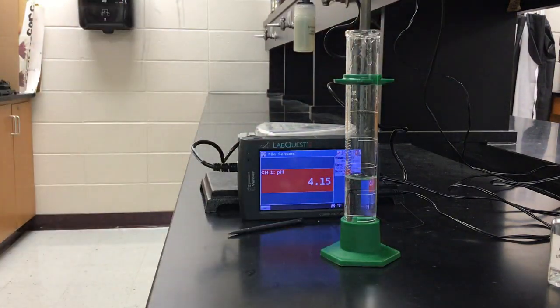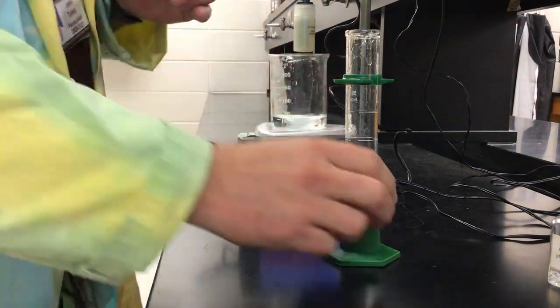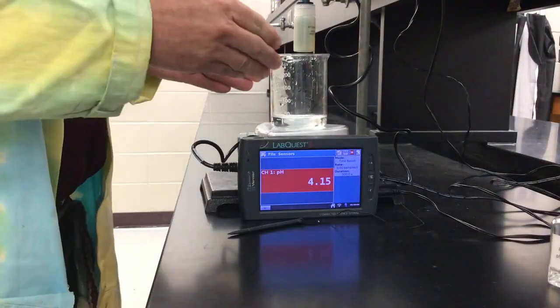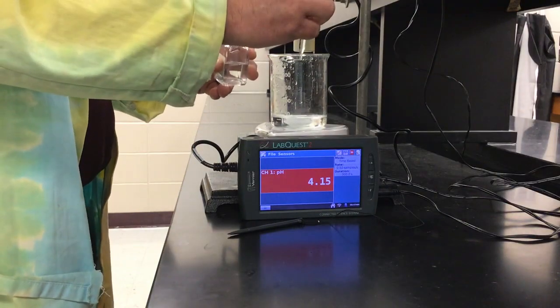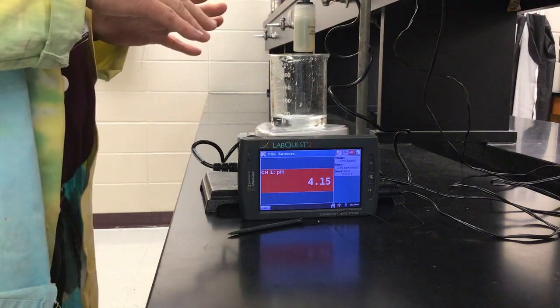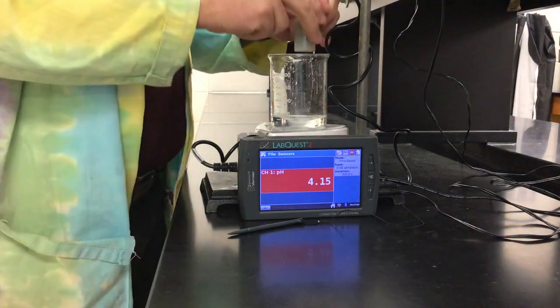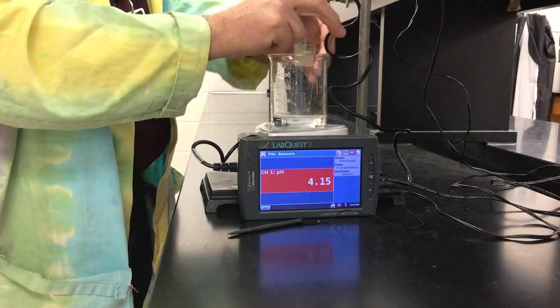So that's 25 milliliters exactly. That was good. So I've got my 25 milliliters here. I'm going to set that off to the side. And I've got my 25 milliliters of my acid solution here, and I'm going to add just a little bit of phenolphthalein, 3-4 drops, in there so that I can see where that equivalence point is going to be. And I'm going to lower my pH probe into the solution so we can measure the pH.